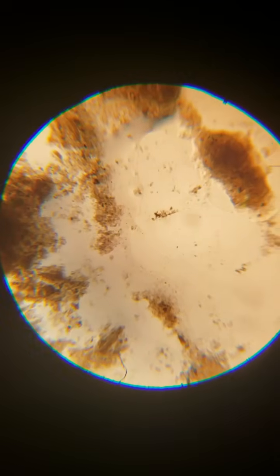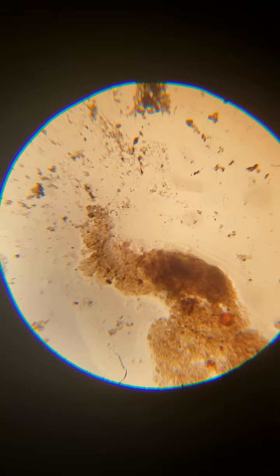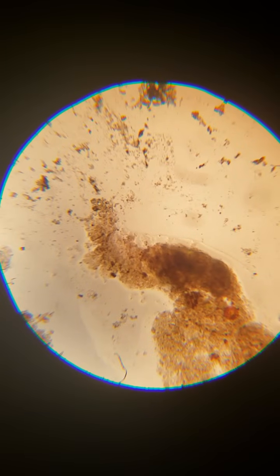You may already know that. This may be an insert to another video, but what I'm going to do is show you what I got under my microscope right now.